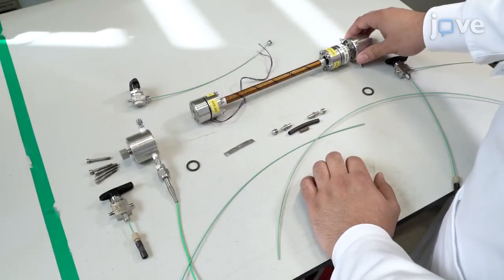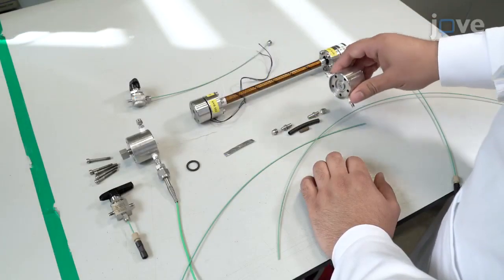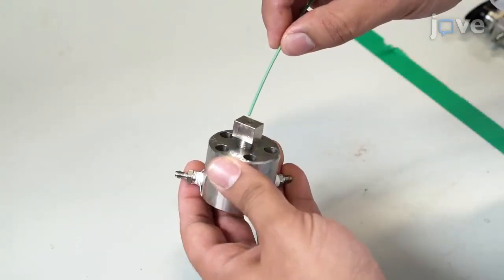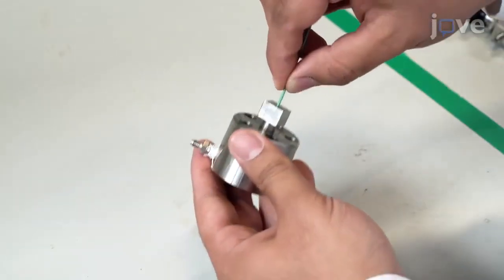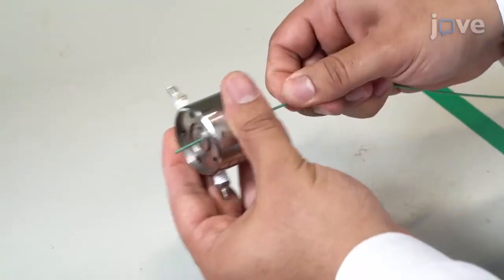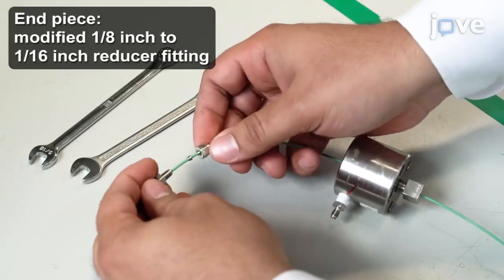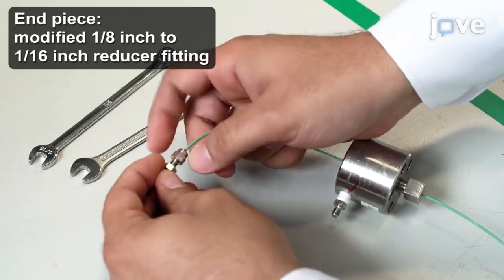During X-ray microtomography, use a Hassler-type core holder. First, work with the core holder's top to thread polyether ether ketone tubing. Then, attach the tubing to a custom-made end piece that accommodates the sample.